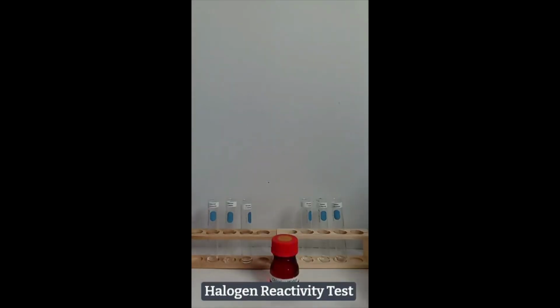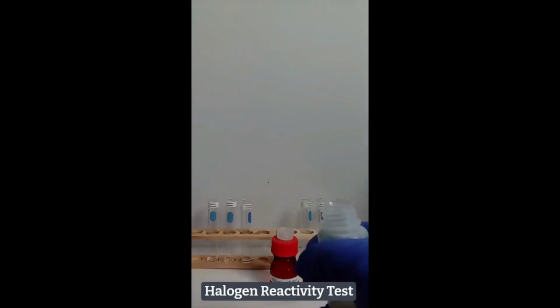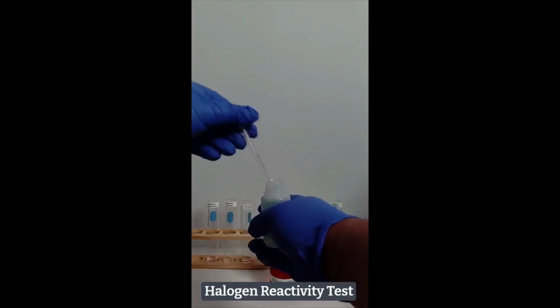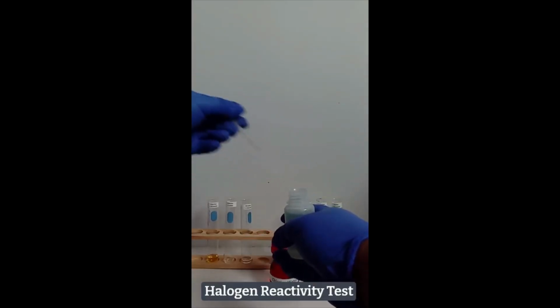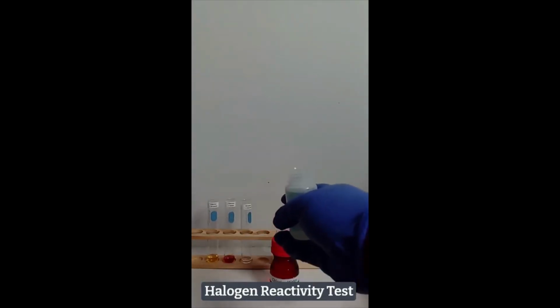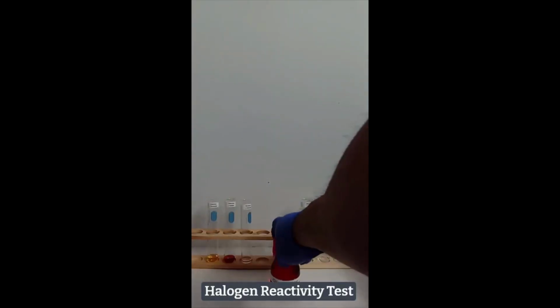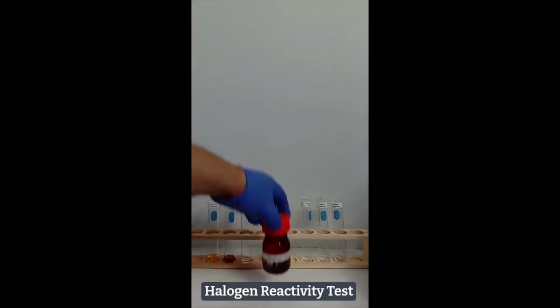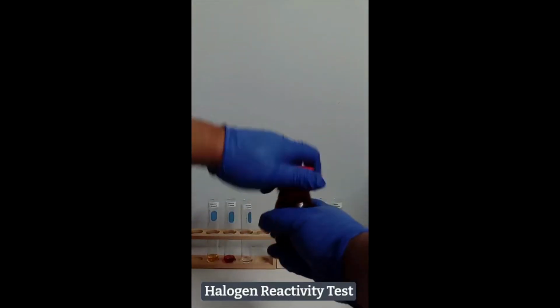Now the halogen waters are added to their corresponding test tubes. 2 milliliters of chlorine water are added to the first 2 test tubes. Two milliliters of bromine water are added to the next 2 test tubes.